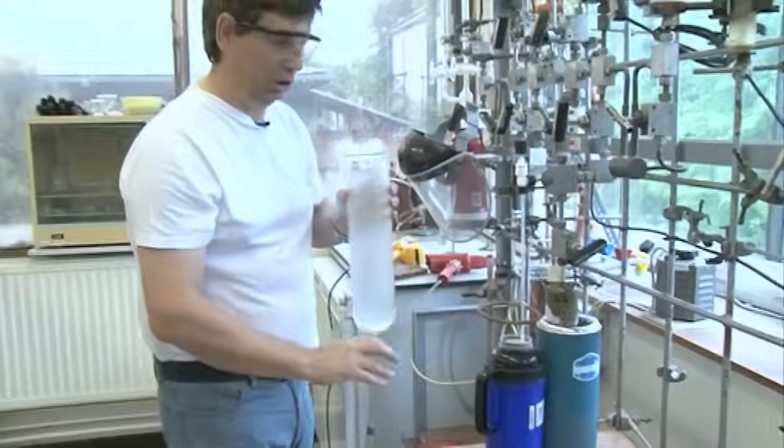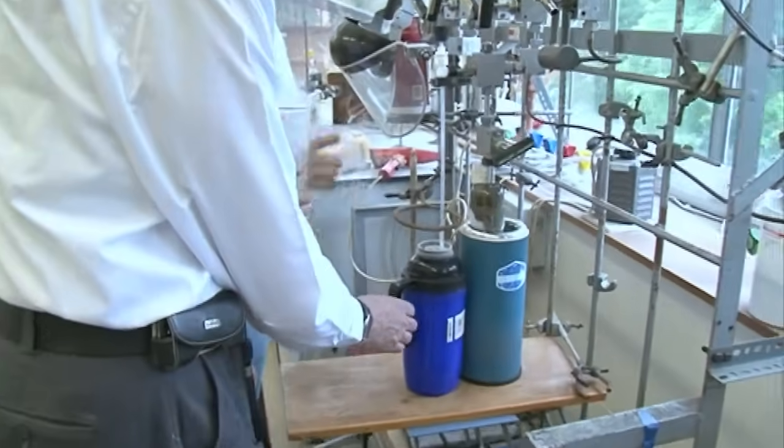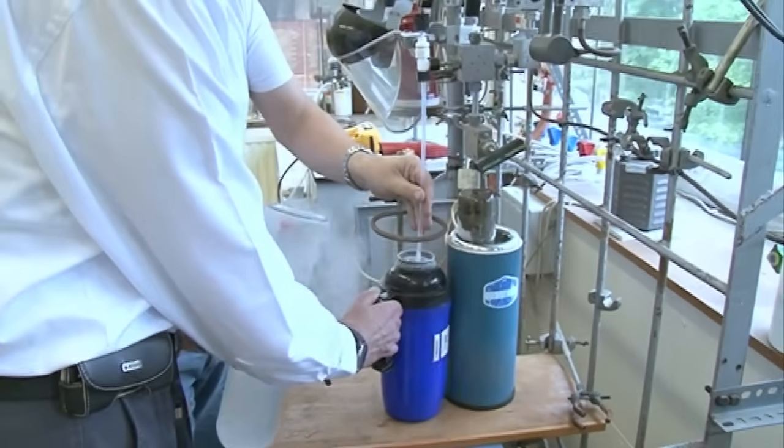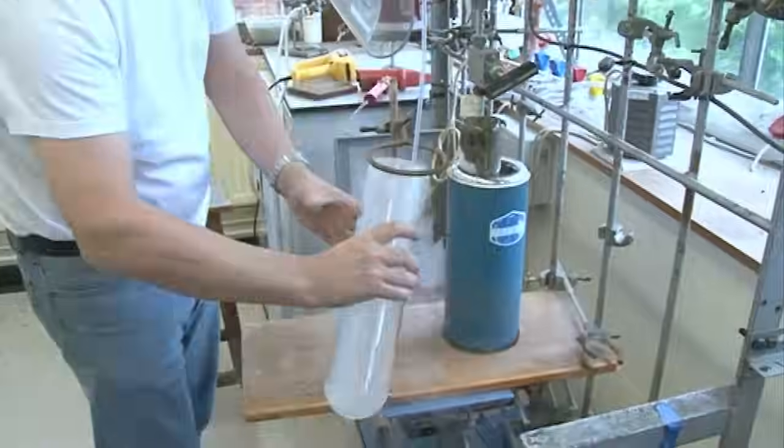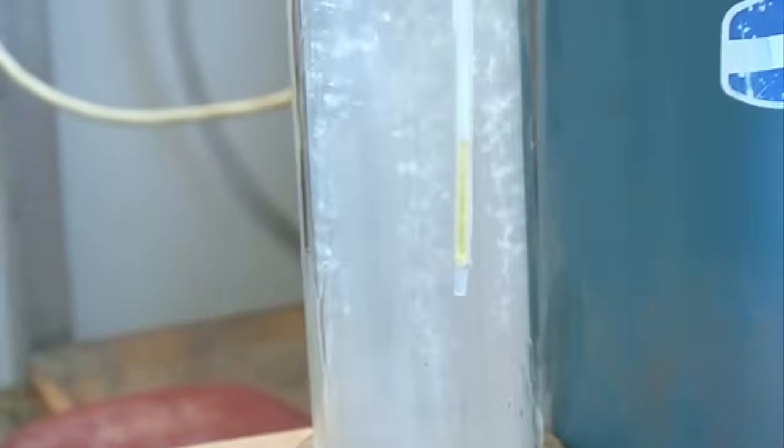Okay Martin, do you want to help me with this? So what I want to do is for you to take that dewar away and then I'll slide this one in. So just slide it away and back up again. And there we have nearly two inches maybe of liquid fluorine. You can go right up. There's no problem with that. If you want to just clear a bit of the condensation off there.